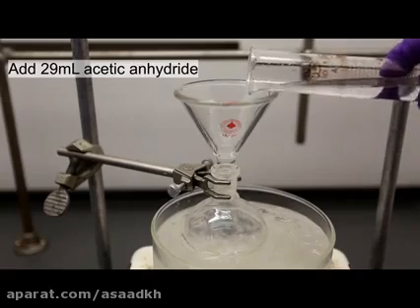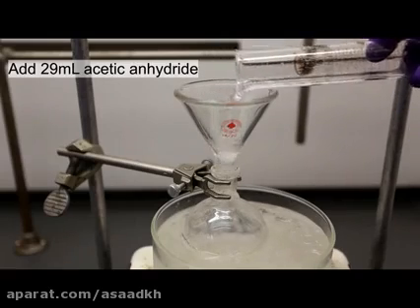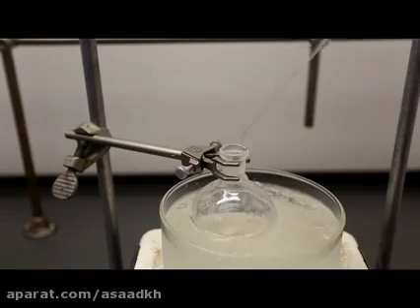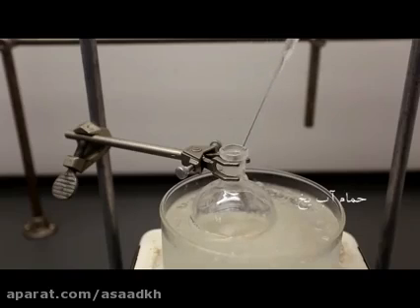First, add 29 milliliters of acetic anhydride to an iced round bottom flask. Next, add 5 milliliters of concentrated sulfuric acid slowly and dropwise. The addition of the sulfuric acid is extremely exothermic, so it is very important to add it slowly and to keep the solution as cold as possible. It is highly recommended to have very strong stirring at this step. In this reaction, sulfuric acid acts as a catalyst.